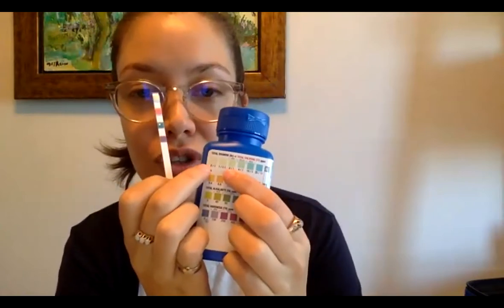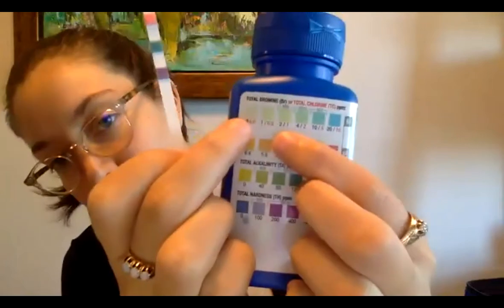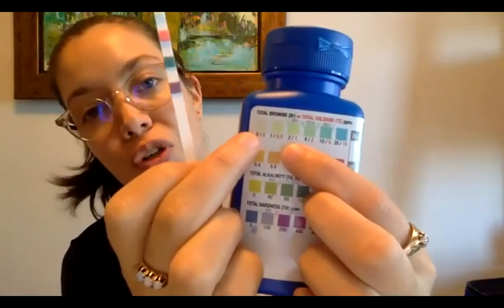So I would look at chlorine and see what my chlorine reading is. And mine is pretty much between 0 and maybe 0.5. This is tap water, so it might have been treated a bit. I could write that down. And if you ever get a value that's between the 0 and the 0.5, then I could write down 0.25.